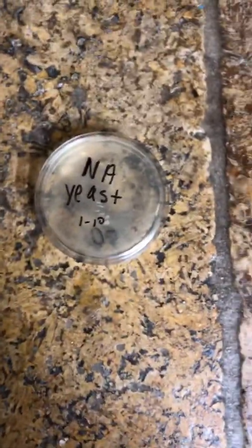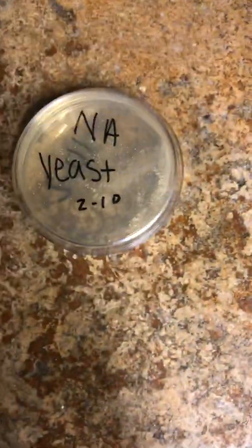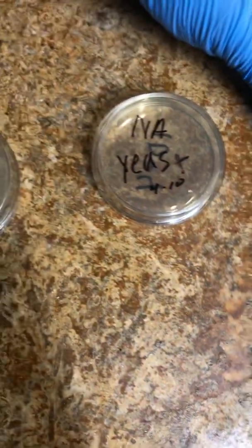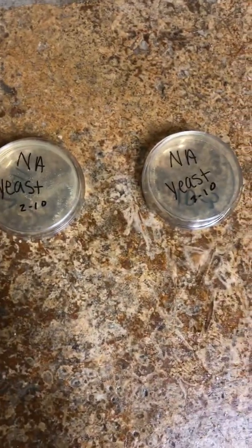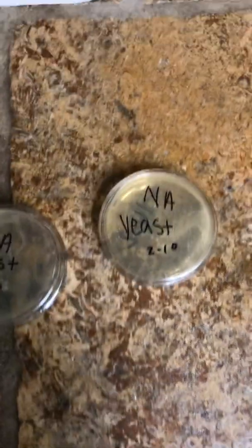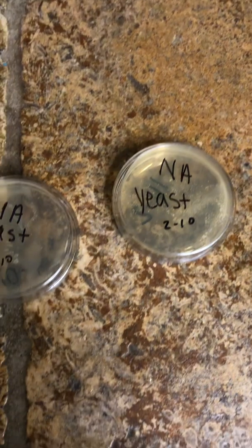Today is January 22nd, 2019, and today I'm going to explain bacterial enumeration, dilution, and plate count. So I want to go ahead and show you each one of my specimens. These were collected a couple of days ago, and these are the actual final results after incubating in the area for 12 hours, then inverting each plate and incubating them again for an additional 48 hours so the specimen can grow in the incubation location.